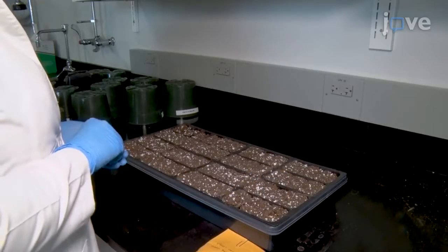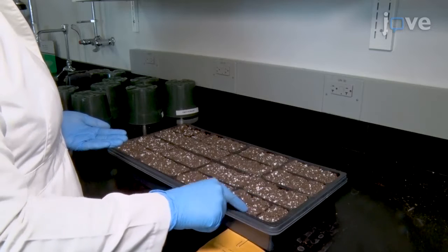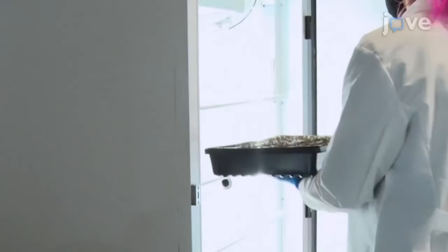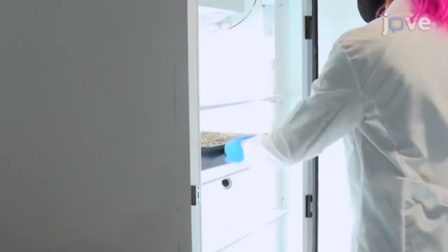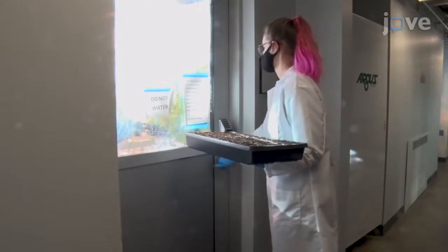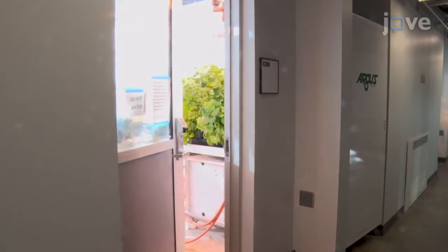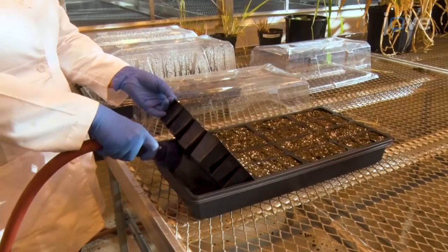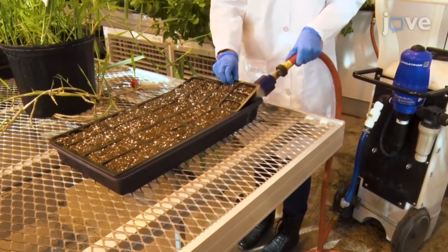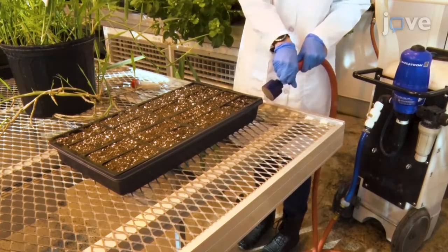Begin by planting 1 to 2 maize seeds in the peat-based growing medium in small inserts placed inside trays. Place the trays in a growth chamber under 16-hour days at 25 degrees Celsius and 8-hour nights at 22 to 25 degrees Celsius, or in a greenhouse at 22 to 25 degrees Celsius with 16-hour days and 8-hour nights. Regularly water plants and fertilize once a week with 15-5-15 liquid fertilizer at 330 parts per million concentration.